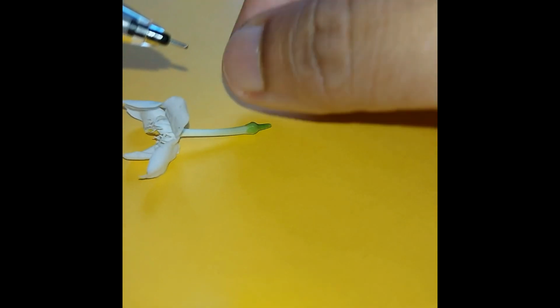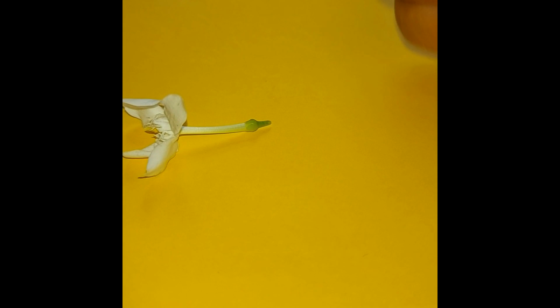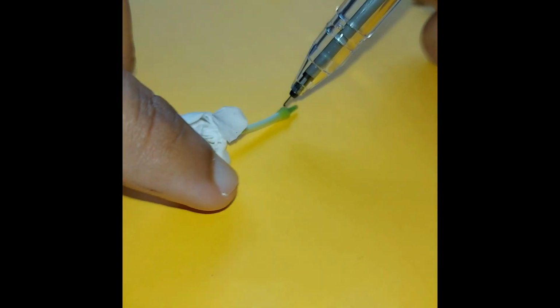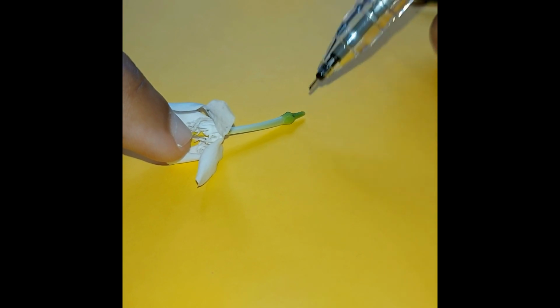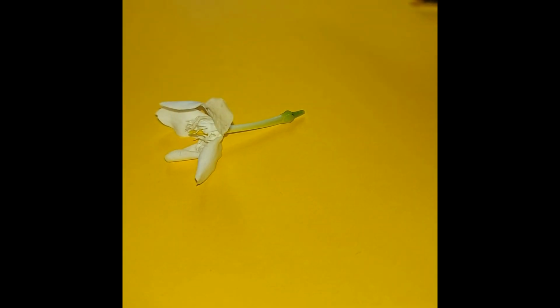Okay, now also this is where the whole thing happens. You will see that the stigma and style is very fine, and all the way down here you will find the sepal. Okay, the sepal is connected to the rest of the plant.